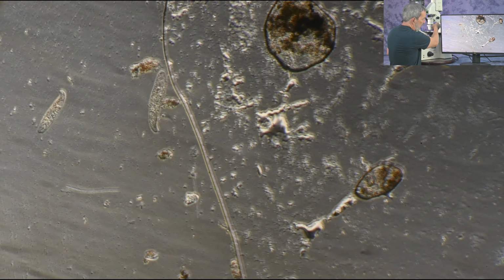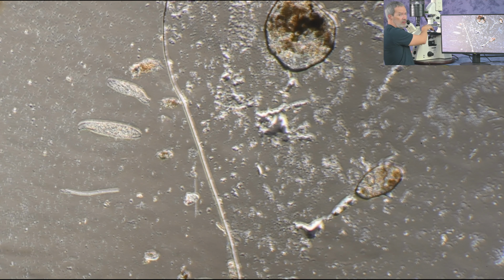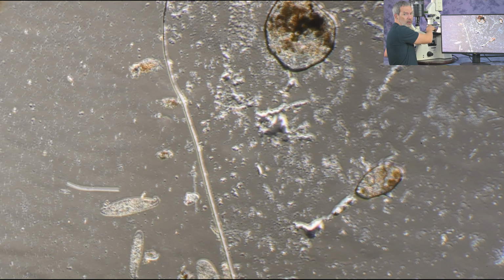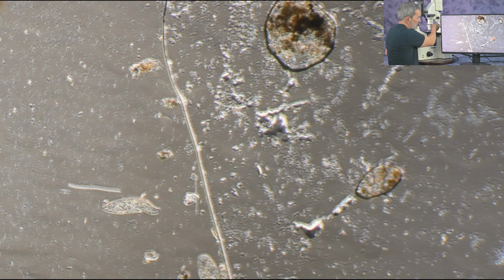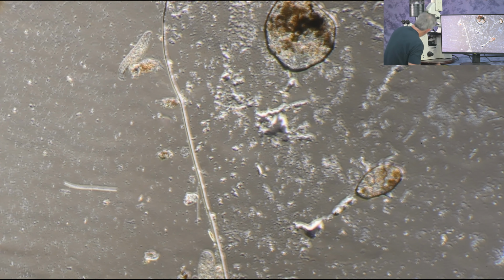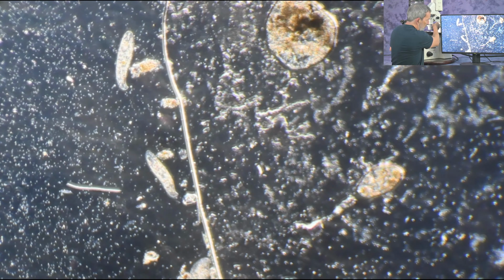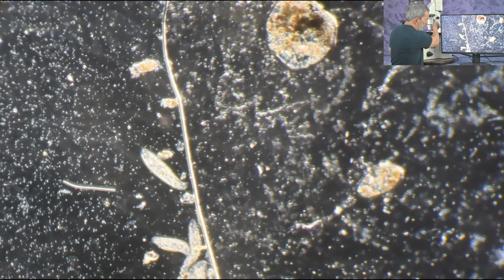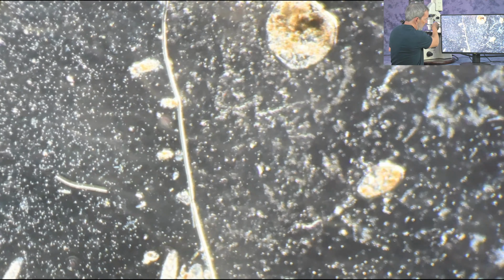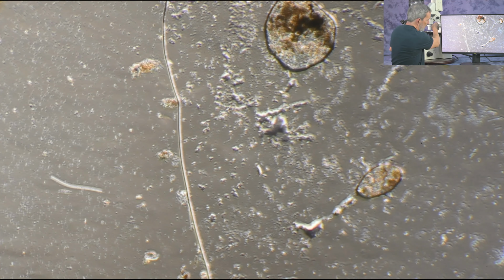Let's take a look at how this looks as I adjust. By the way, this is the Varel adjustment. And this particular one is a VAR 1 and a VAR 2. It depends on the objective you're using. So right now, I've got it on the 10 power. Yes, I'm just confirming that. 10 power uses the VAR 1. Notice we're going into a pseudo dark field. So going all the way into that pseudo dark field, and I'm going to turn it back to where we were. And we go into more of that 3D relief pattern.